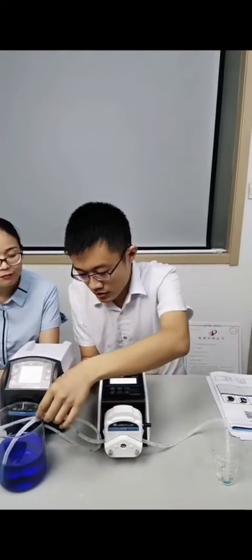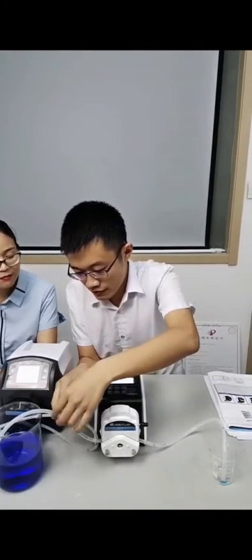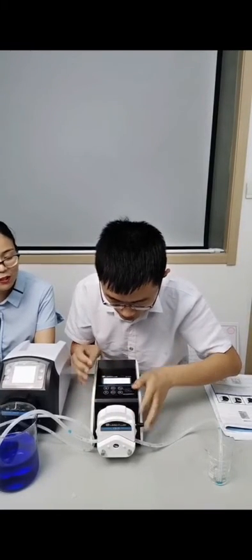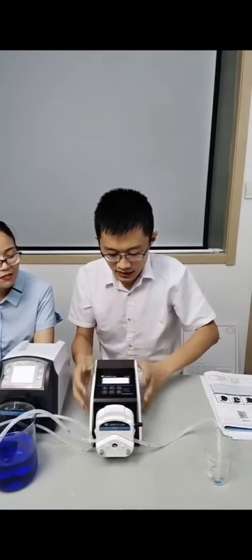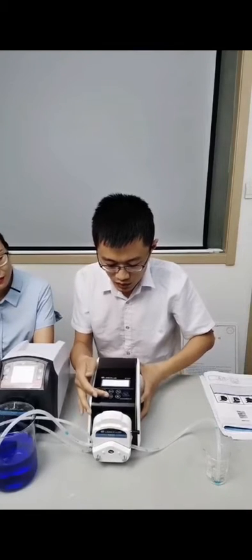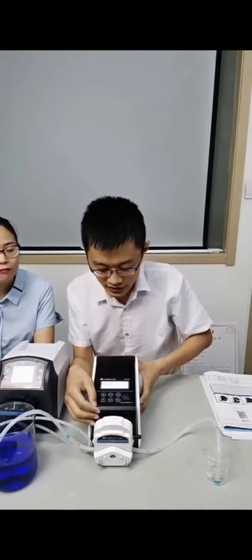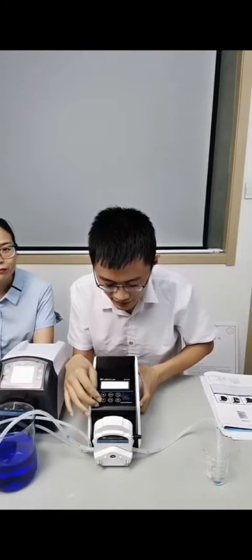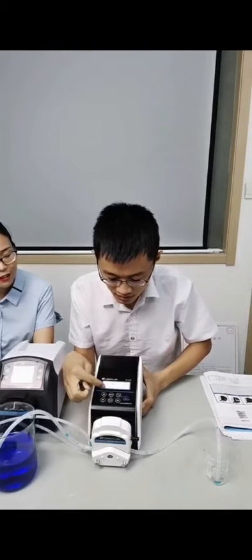First, we must confirm the tube is full of liquid. How to do that? I forgot one thing. I want to show you the different keys on the LCD display. There are seven keys on the display.